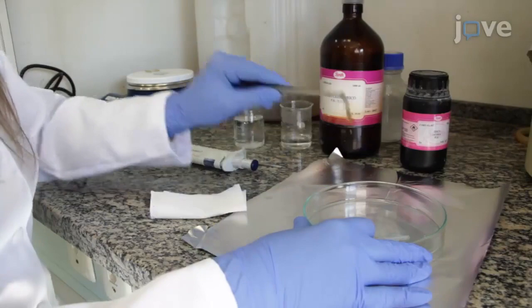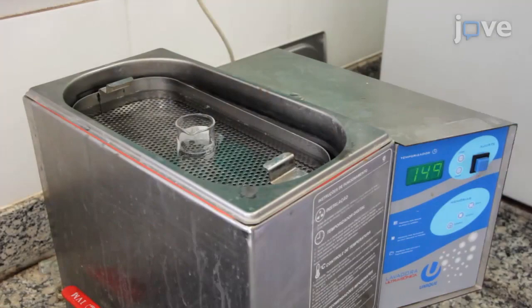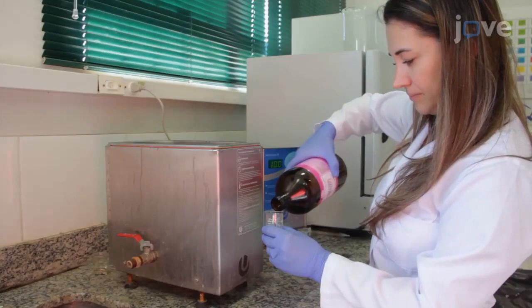Immediately wash the substrate with deionized water, remove the tape, and sonicate the substrate with soap for 15 minutes, followed by two cycles in water, acetone, and isopropanol alcohol.